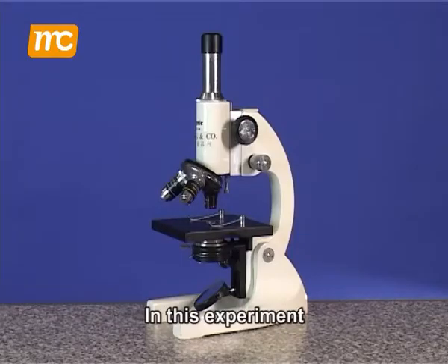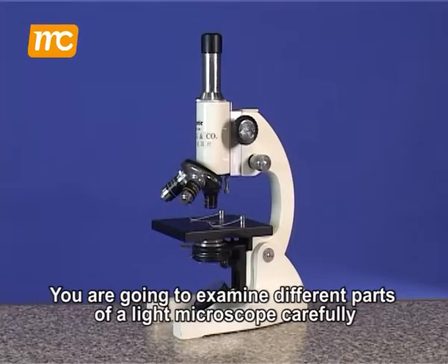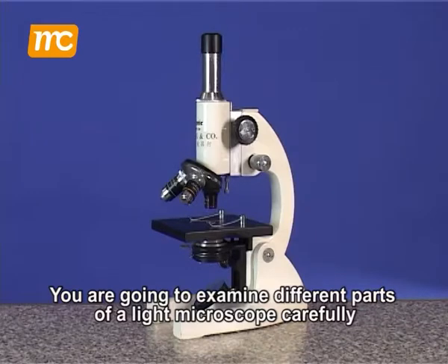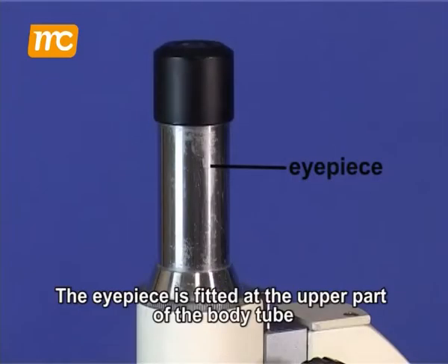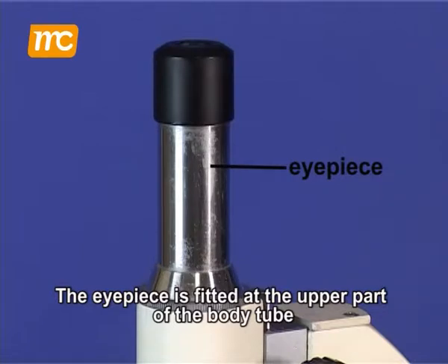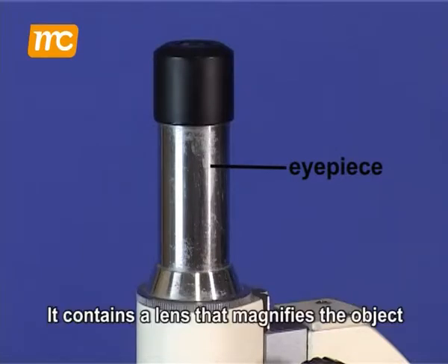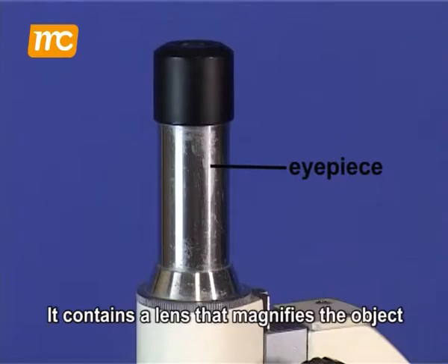In this experiment, you're going to examine different parts of a light microscope carefully. The eyepiece is fitted at the upper part of the body tube. It contains a lens that magnifies the object.